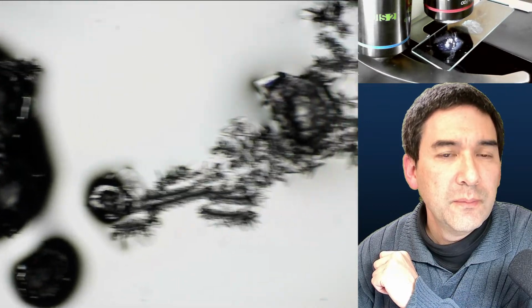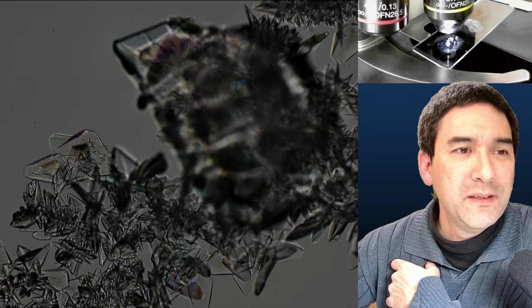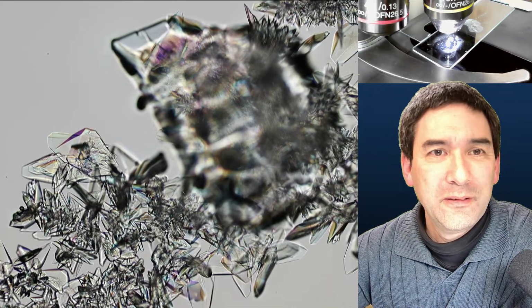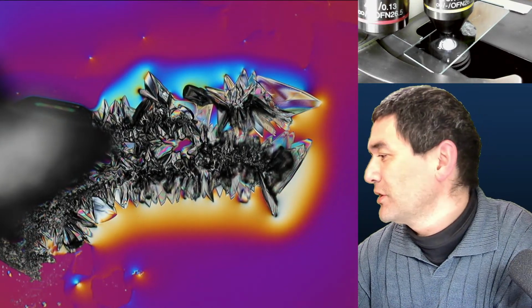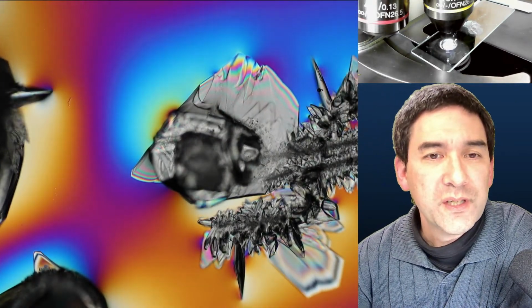Okay. Yep. So sometimes it wants to crystallize, but it can't because there is no starting place, so to say. And then you kind of help it a little bit, and then it will take off and it will start to proceed. Yeah. Okay, I think you get the point. So plenty of things to experiment. Let me see a little different place. Maybe what about over here? Oh, yeah, here as well. Sometimes crystallization will start quickly and then it will stop again. So I think it depends quite a bit on the concentration of the substance.